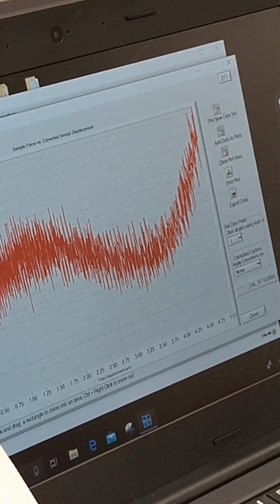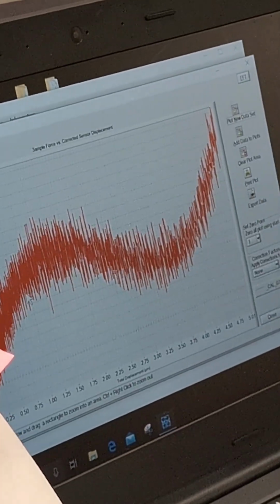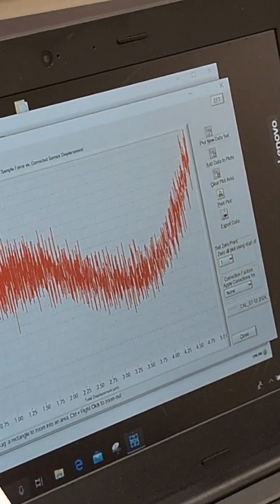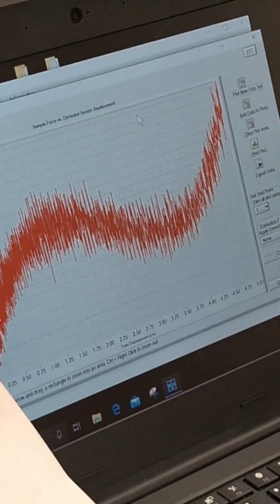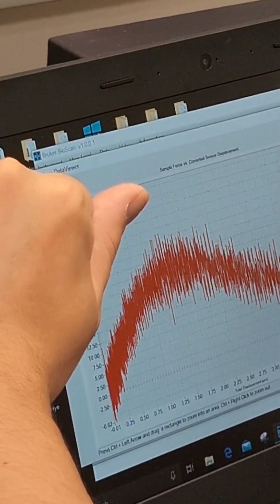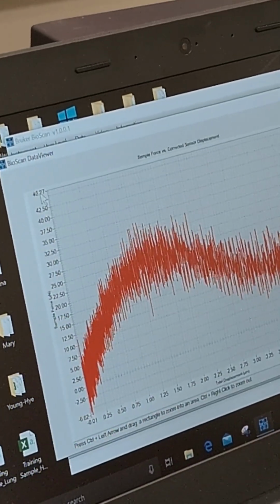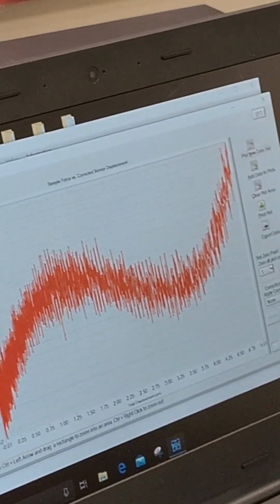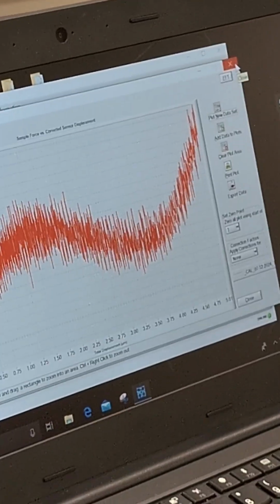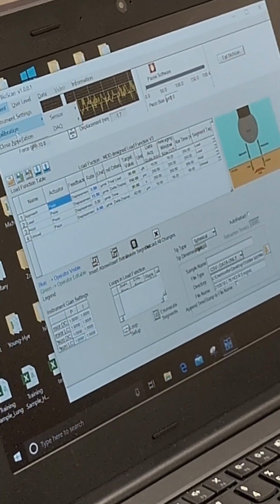So this is actually not good enough. What happened is that, my understanding, as it goes further, either going down or going up, the error force is getting too big. You want to limit the error of this between positive 20 to negative 20. It used to be positive 10 to negative 10, but I just don't think it can go back to that prime time due to its age. So if you see something like this, I would just try to recalibrate it again.